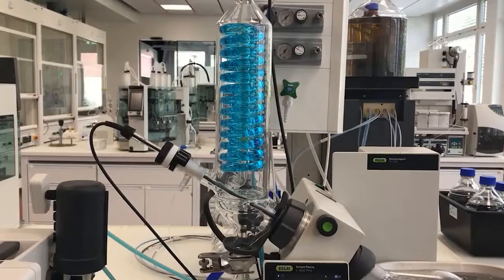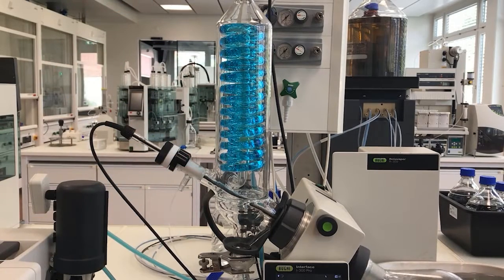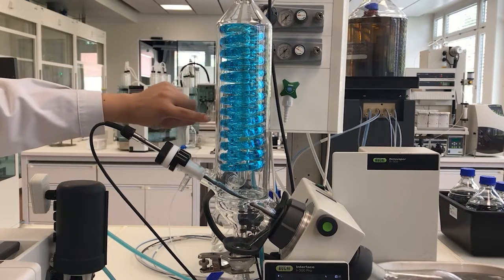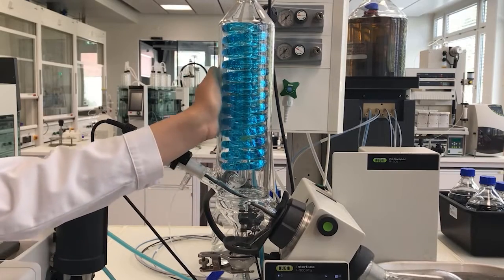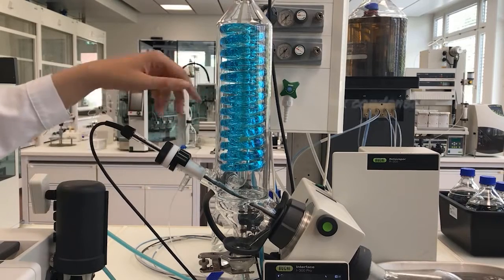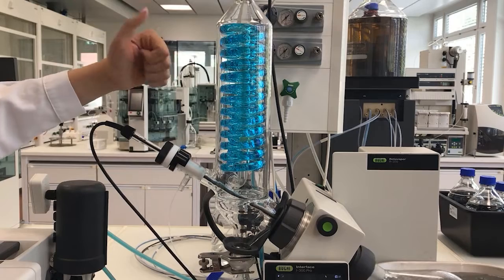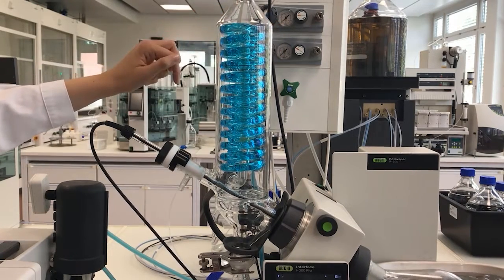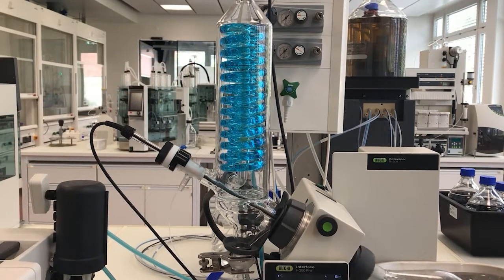The condenser loading is an indication of the distillation rate. You can check the condenser loading by looking at the droplets of solvent, or by touching the condenser and assessing where it is warmer. The maximum condensation level is at 75% and is shown by a line on the condenser. If it goes above the line, your pressure will need to be increased. If it's lower, the pressure needs to be decreased.